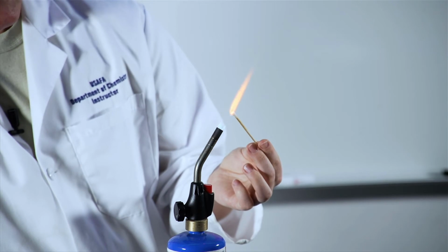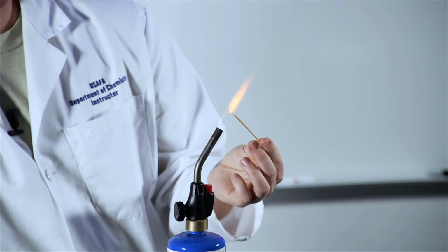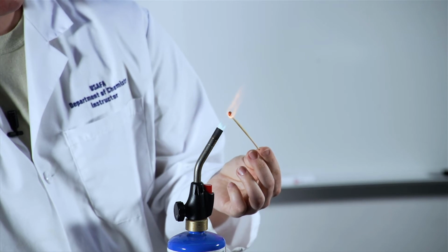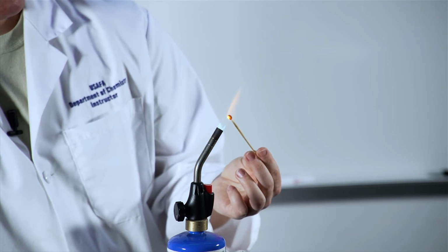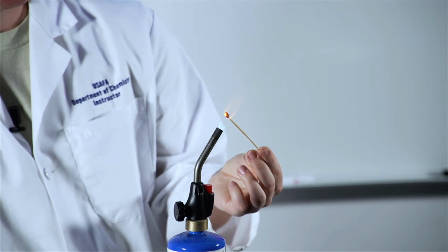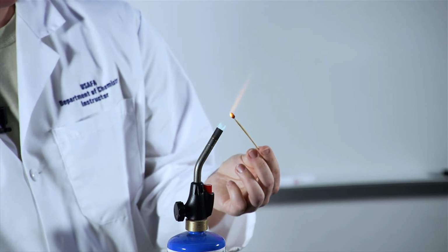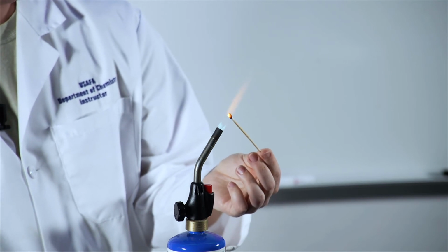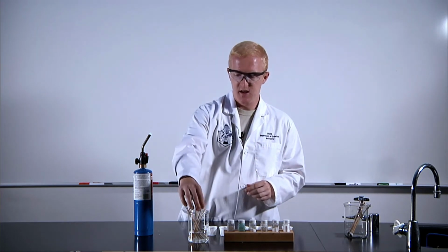A lot of what we're talking about now is how our electrons fill those orbitals. How do the electrons exist in those orbitals? This is a huge piece of the colors that we see. What else I hope everyone's picking up on is that all of these colors, we haven't seen enough of them yet, but you can use them to identify the particular metal. In early chemistry, this was one of the ways they tried to figure out what was part of what. And you still use similar techniques in advanced spectroscopy to identify what the metals are, because those transitions are inherent to them.